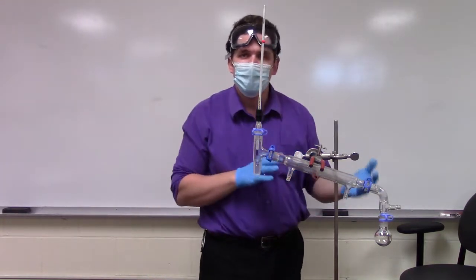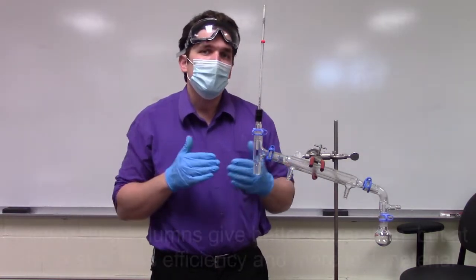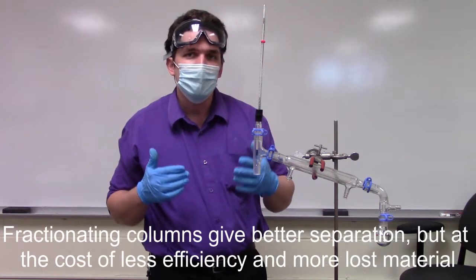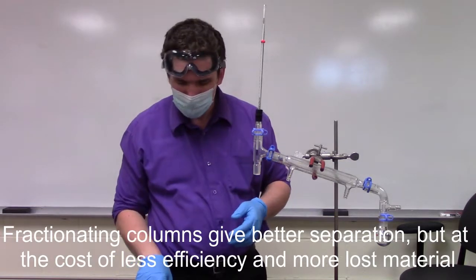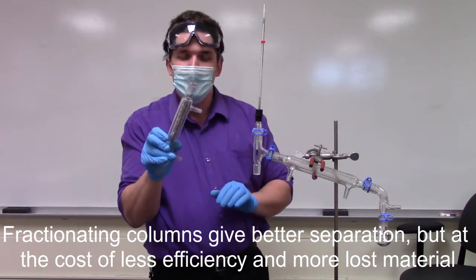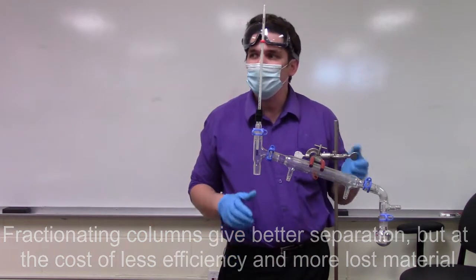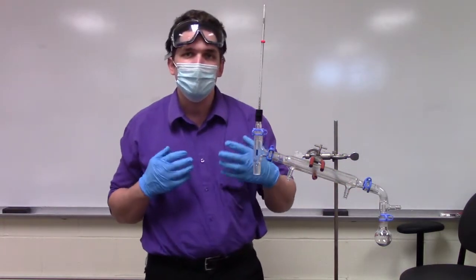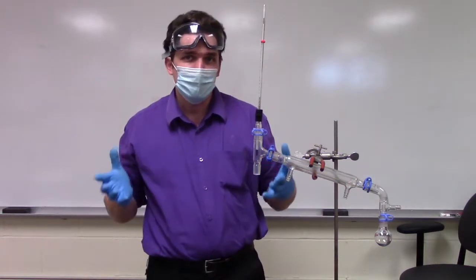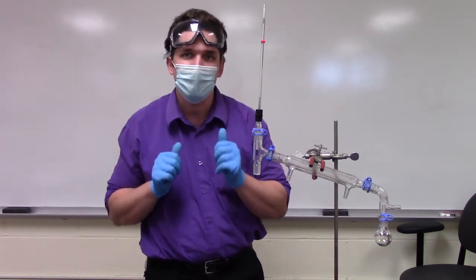As you start going from fractionating to packed or fractionating to much better fractionating, you end up getting much better separation, but the cost here is both time and yield. Any vapors you condense in this column are kind of lost to this column. So you're going to end up not getting as much recovery with a fractionating column, but what you do recover is going to be on the order of much better purity. So this is your review here of simple, fractional, and packed column distillation.